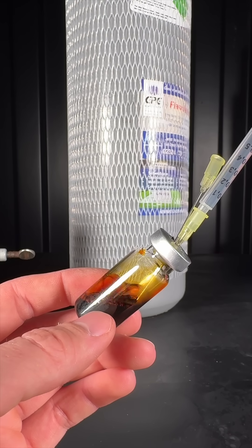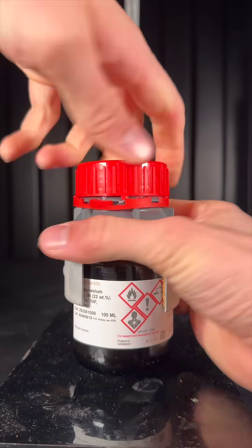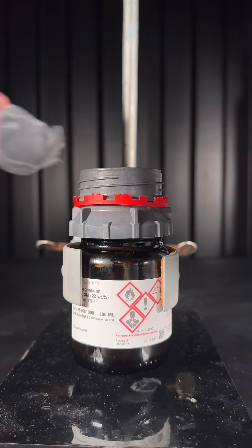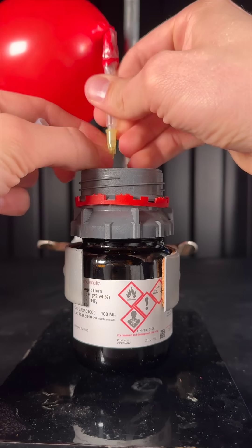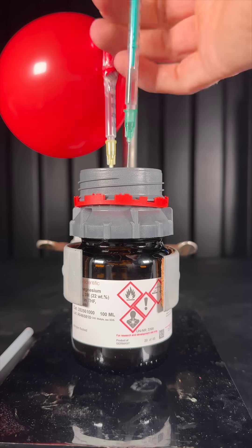I carefully bubbled argon into the solution to remove leftover air. As Grignard reagents are super air sensitive, I connected an argon balloon to the bottle.